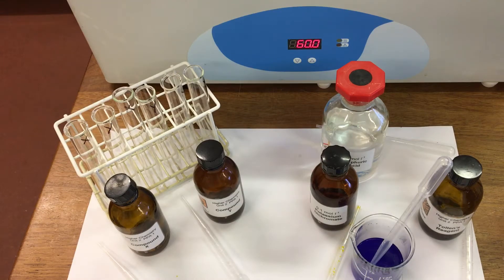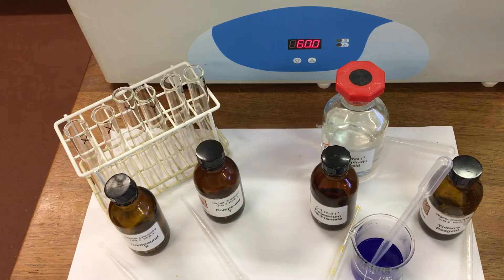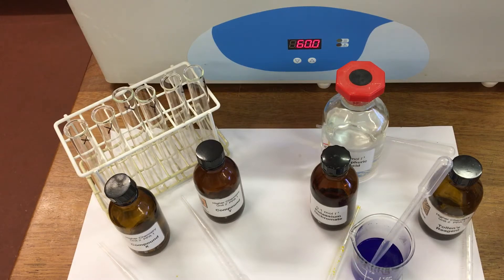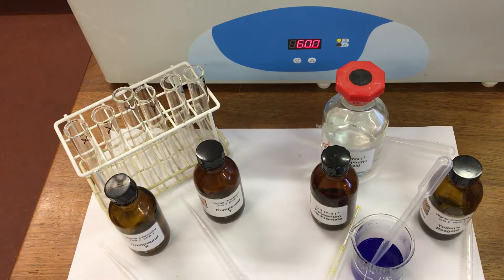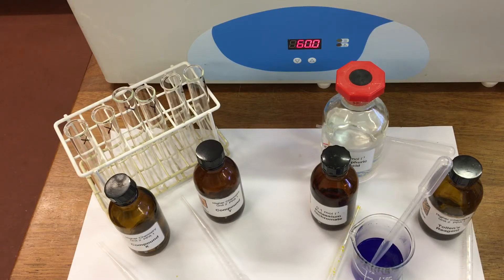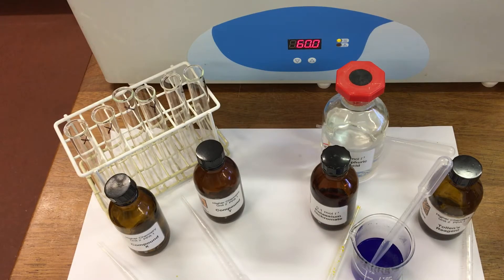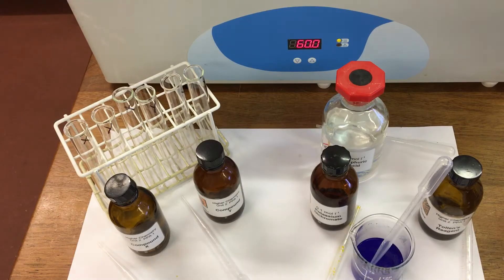In this experiment we're looking at oxidation reactions. The aim of the experiment is to use three different oxidizing agents to distinguish between two different compounds — one is an aldehyde and one is a ketone.